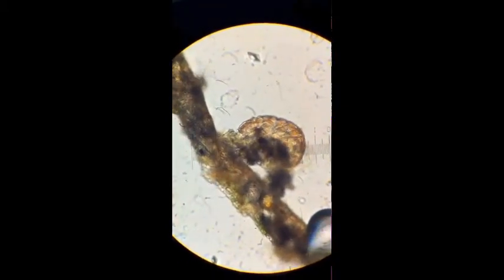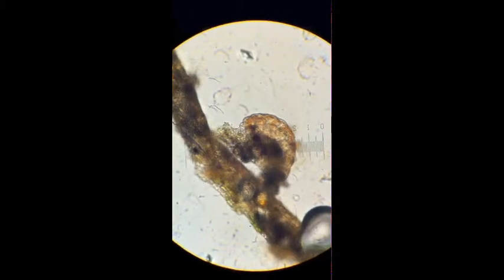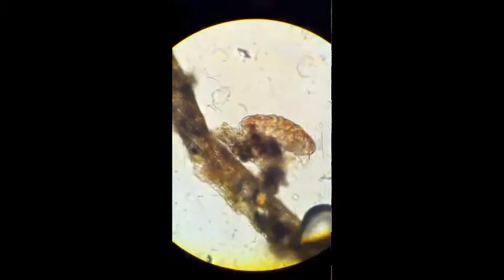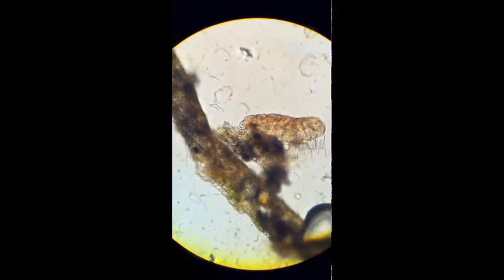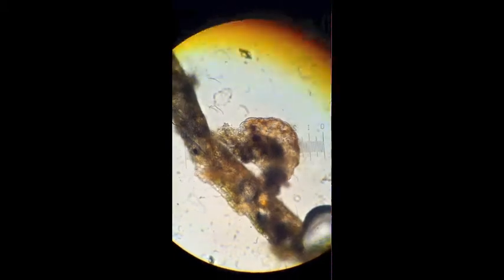This is a tardigrade. They're amazing creatures and have the ability to curl up into a tight tun form and survive extreme environments. For example, they can survive complete desiccation, being frozen in ice, boiled in alcohol, but most importantly, they can survive in outer space.